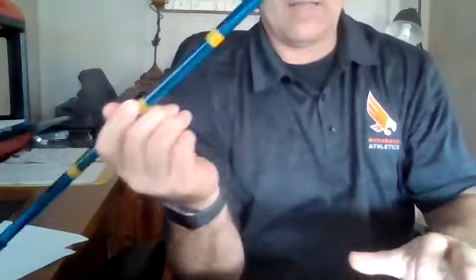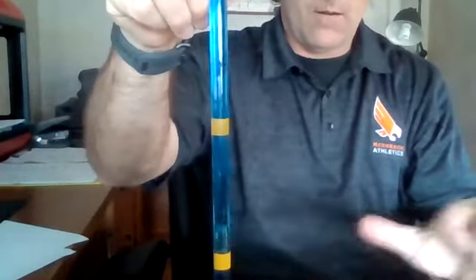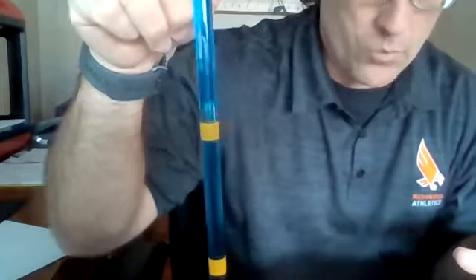Blue at 10. 1.5. All right, so now we have all of our data for the larger tubes.